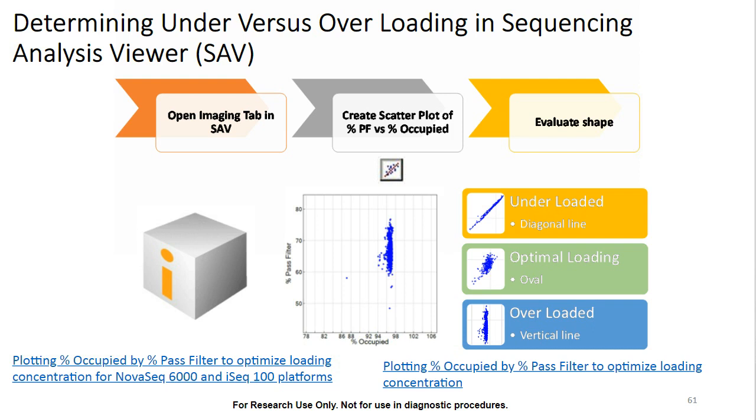Now, optimal loading will tend to form an ovular, cloud-like shape that will typically be in the top right corner of the graph. Whereas overloading conditions are going to show saturated percent occupancy but low clusters passing filter, so it'll show a vertical line usually pushed all the way over to the right of the graph. Now, we do have a couple of support bulletins on this as well as a video, so we would definitely recommend checking those out because these can be incredibly helpful in evaluating and optimizing our loading concentrations for our libraries.